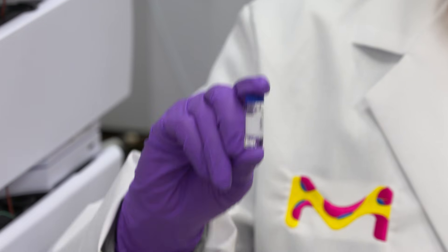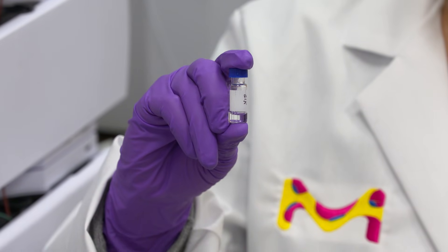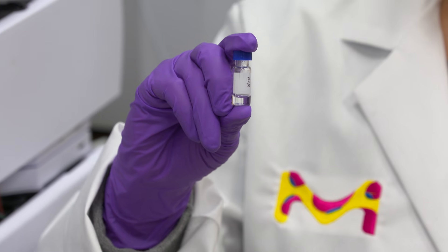When running your standards, you want to make sure you run your standards in multiple injections. That will ensure repeatability.